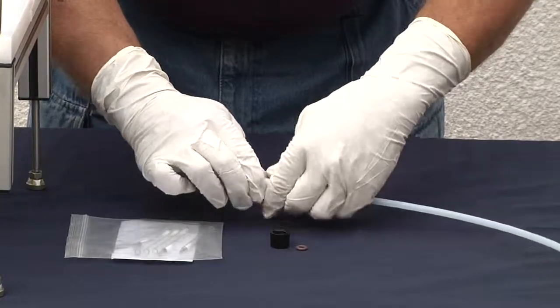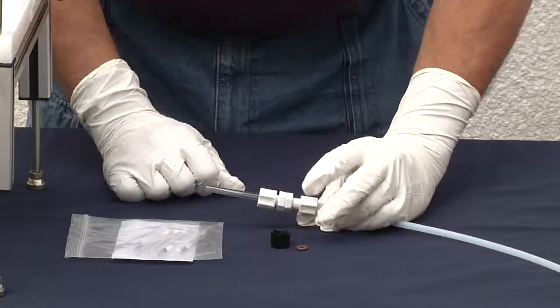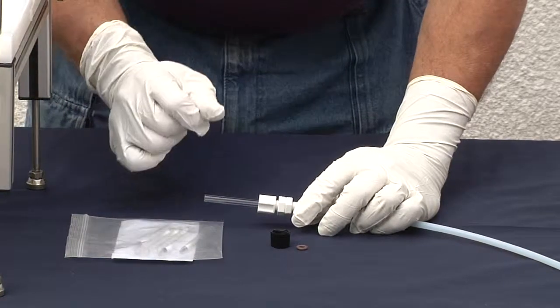We tighten up and now we have our VCT locked into our holder with our tubing that'll go to our vacuum.